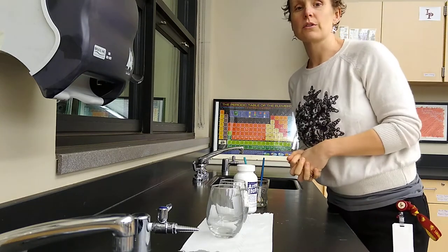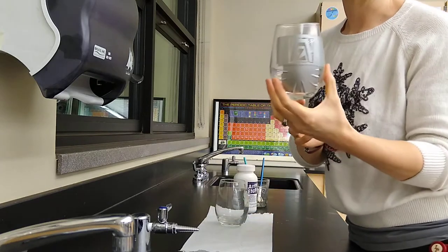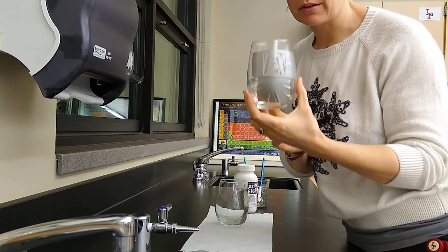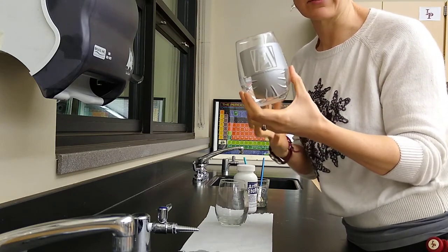Okay, so this part of the video is going to go over the glass etching process. You should have carved a design in some duct tape with an exacto knife and exposed some glass in whatever design that you have chosen.